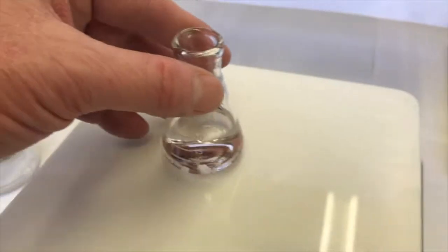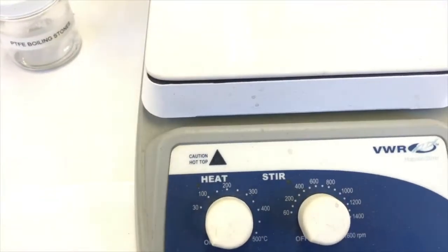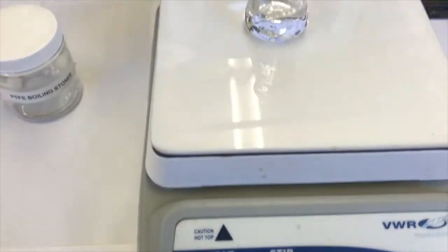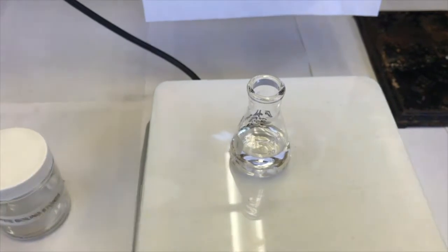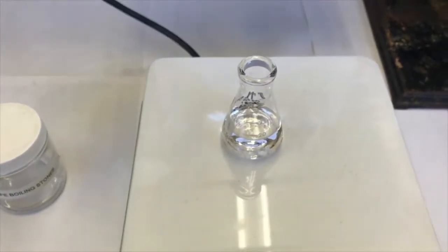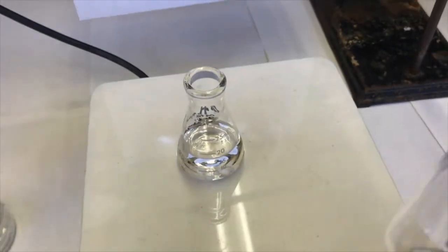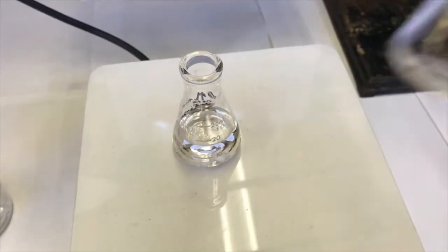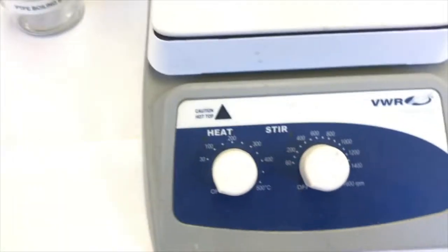So now I want to take this ethanol flask with the boiling stones. I want to put it on my hot plate and get it heated up, because I want it to be boiling gently for this crystallization, and it'll take a little while to boil. So what I'm doing is I'm starting the heating of this first before I weigh my sulfanilamide solid into this other flask. Okay, so let's turn this heater on. How do we do it? So right now it's off. It's in the off position.